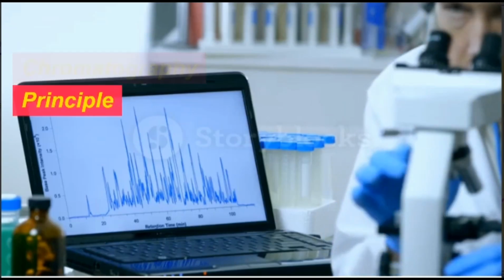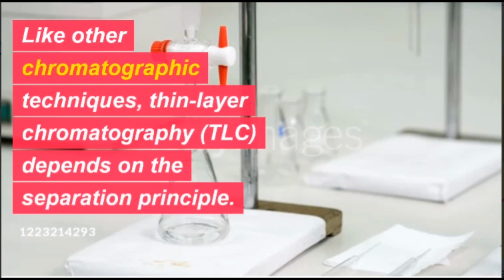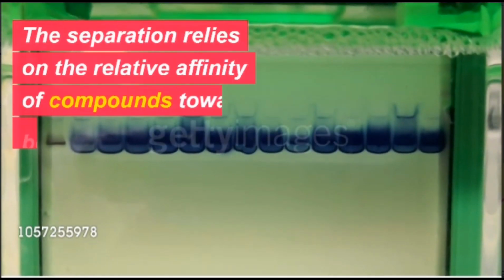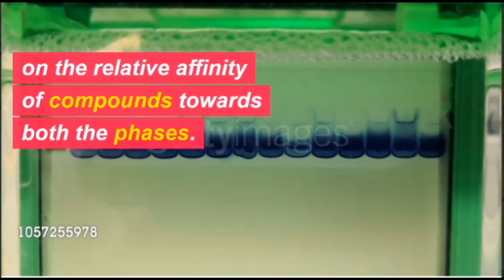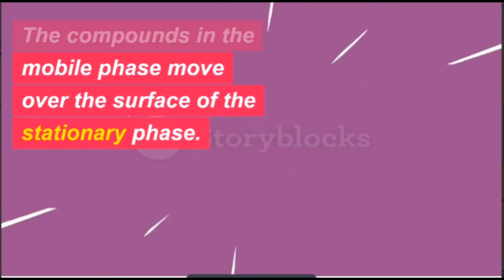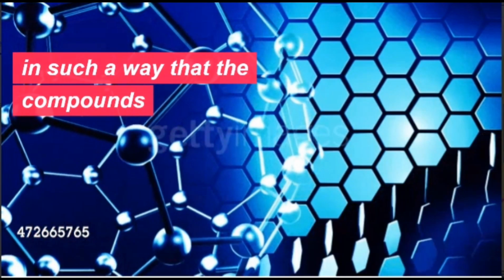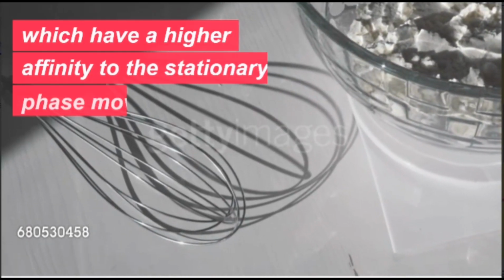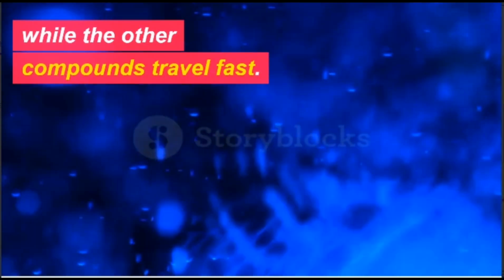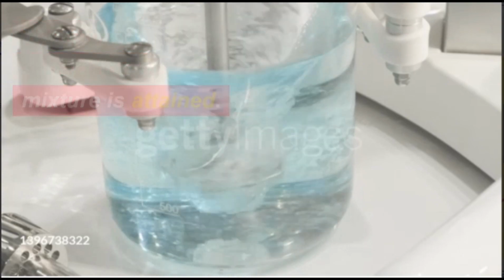Thin layer chromatography principle. Like other chromatographic techniques, thin layer chromatography, TLC, depends on the separation principle. The separation relies on the relative affinity of compounds towards both the phases. The compounds in the mobile phase move over the surface of the stationary phase. The movement occurs in such a way that the compounds, which have a higher affinity to the stationary phase, move slowly, while the other compounds travel fast. Therefore, the separation of the mixture is attained.